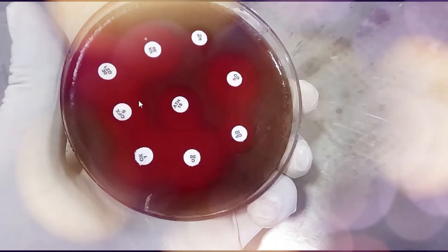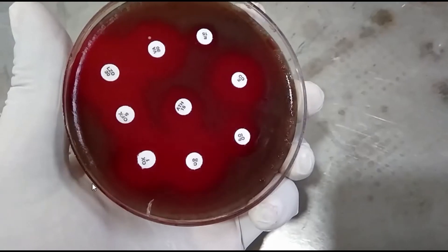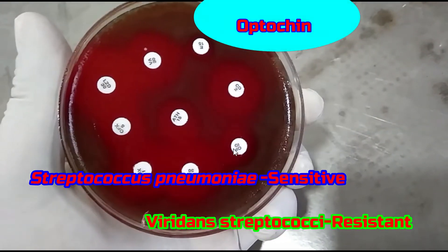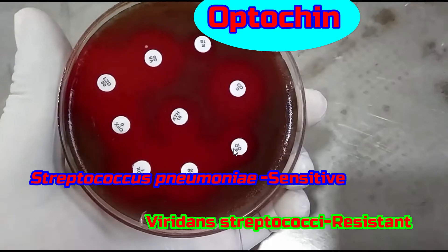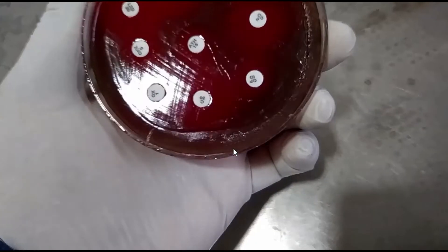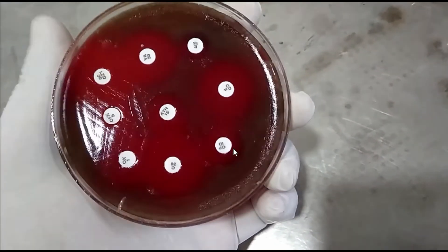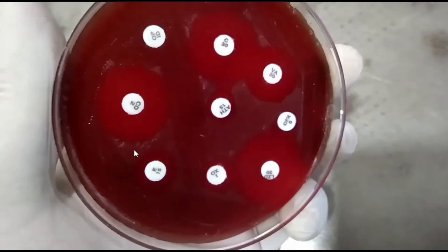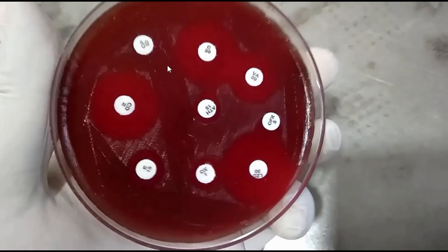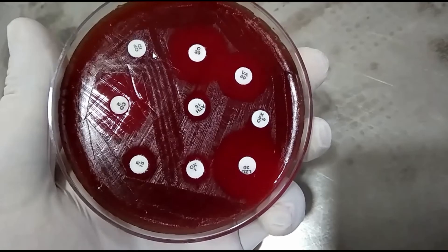And this here is the viridans streptococci, because we can see that this organism is resistant to optochin.